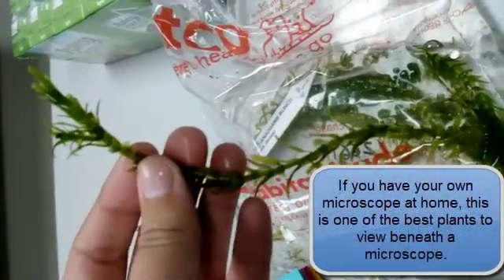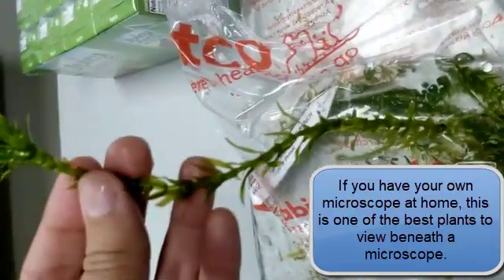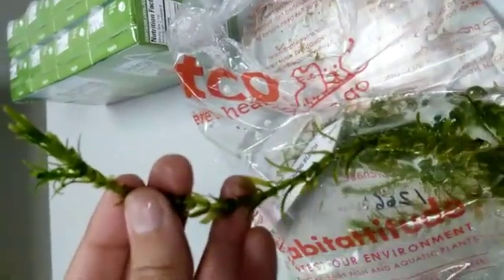The reason we use anacharis in biology class is because the leaves of an anacharis plant are only a few cells thick. So it's easy for the light to shine through for us to be able to see the details on individual cells. So this is what we're about to look at under the microscope.